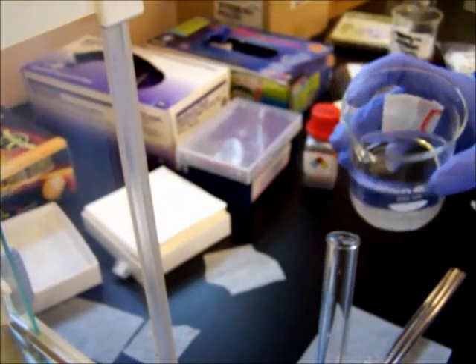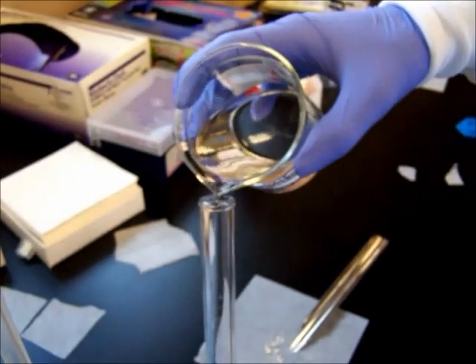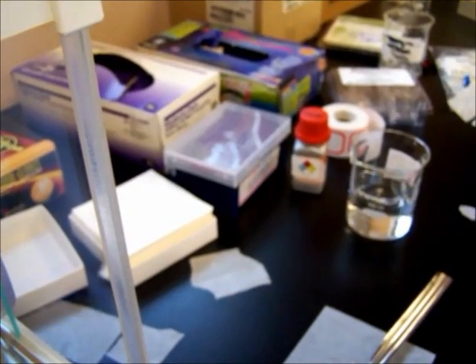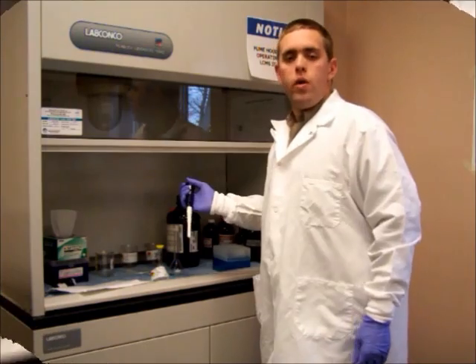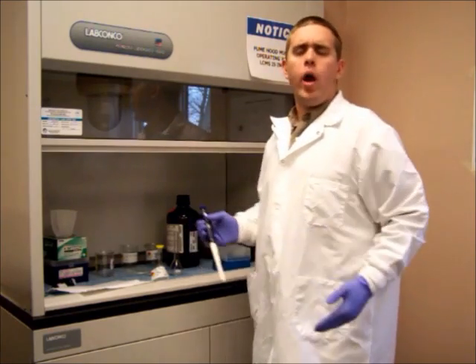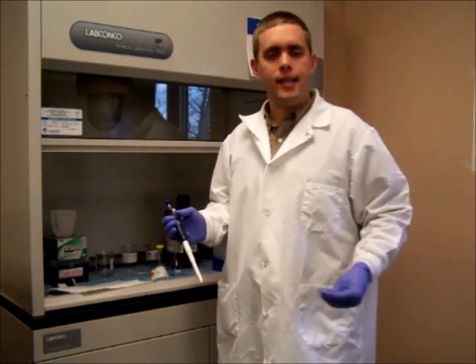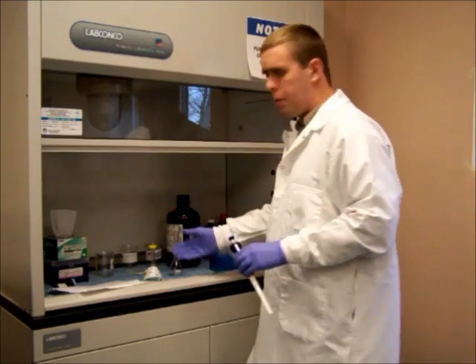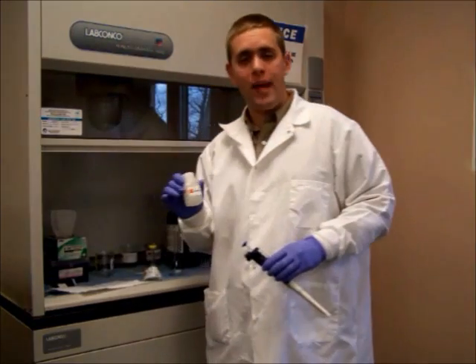Now I always like to dissolve a little bit of methanol in there next, just to begin the dissolving process. So now you can see most of the material we've put in there has already been dissolved by the methanol. The next thing we need to do is add the formic acid. So coming over to the hood, we're going to add one milliliter of formic acid to our polyphenol. You want to add a quantity of formic acid because the formic acid helps in the ionization process. So we have here some 5% formic acid. This was prepared in advance using a stock 100% formic acid solution.